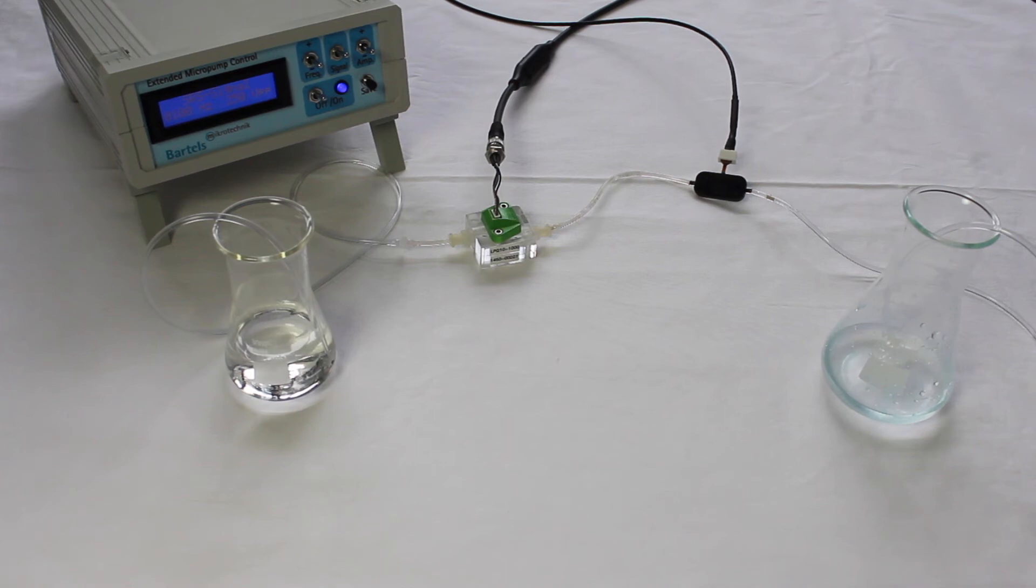Using the correct restrictor, your desired maximum flow rate can be achieved, yet the full pressure generation range is available.